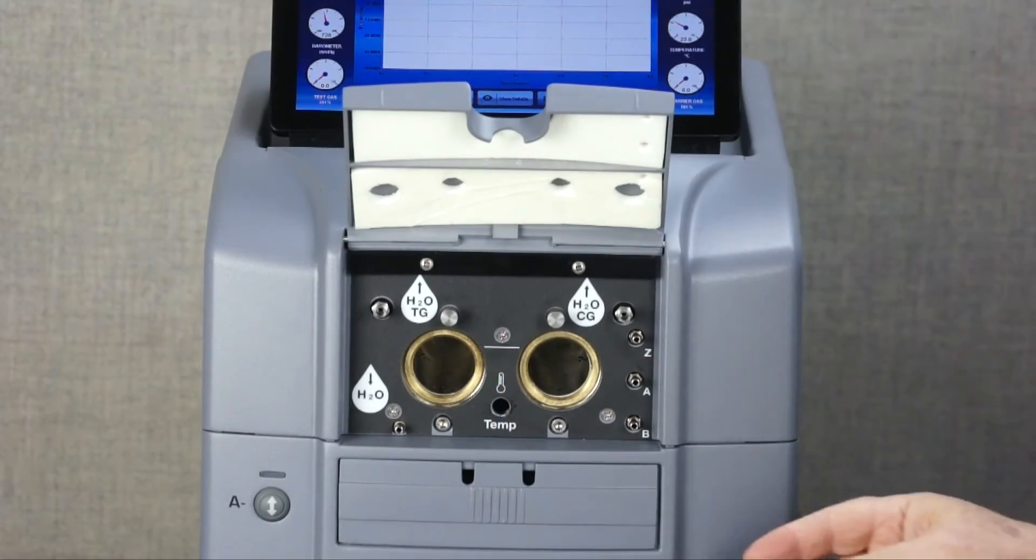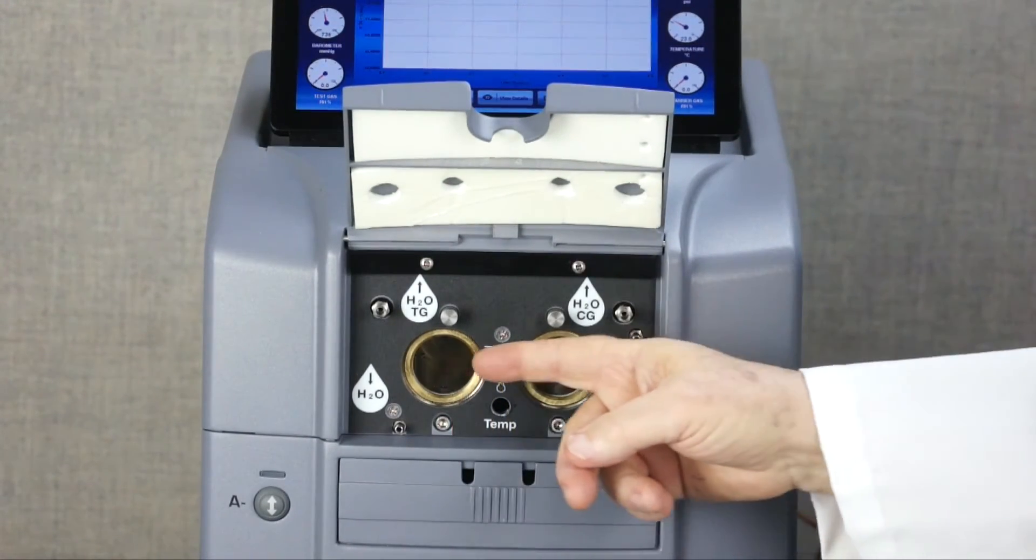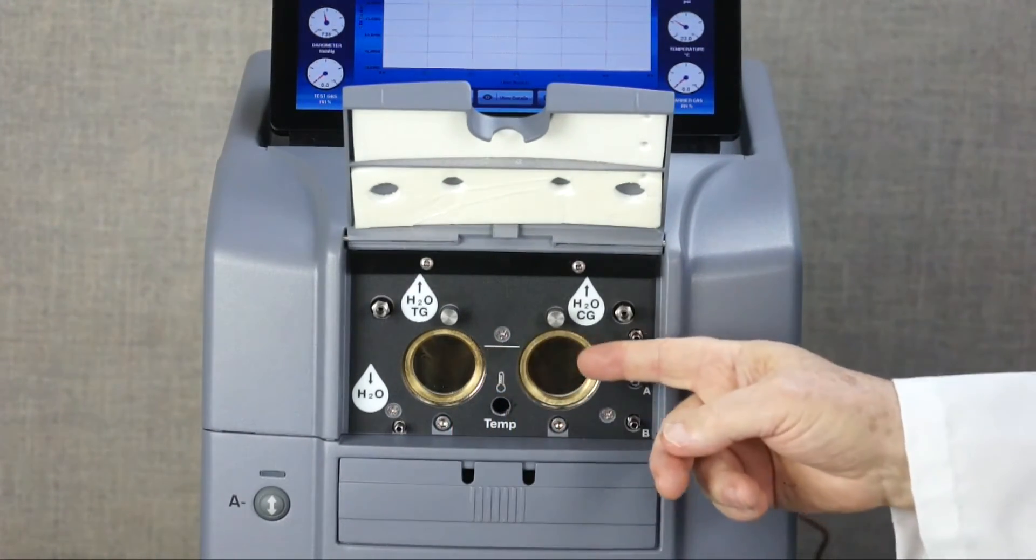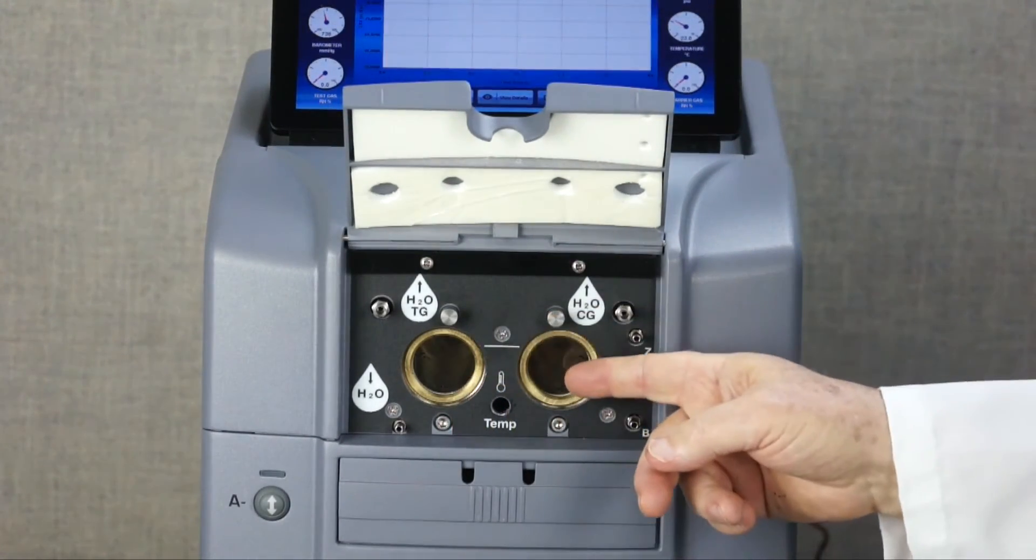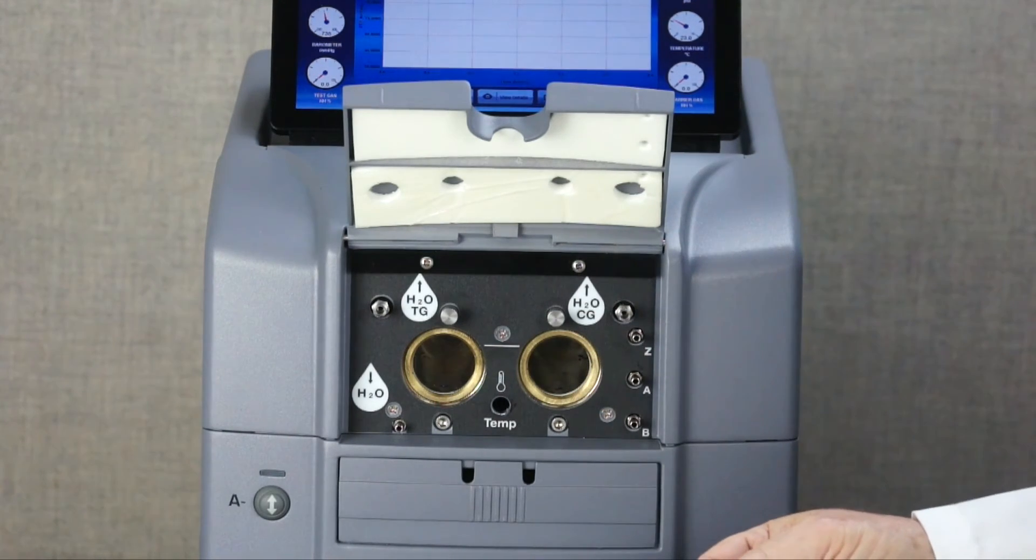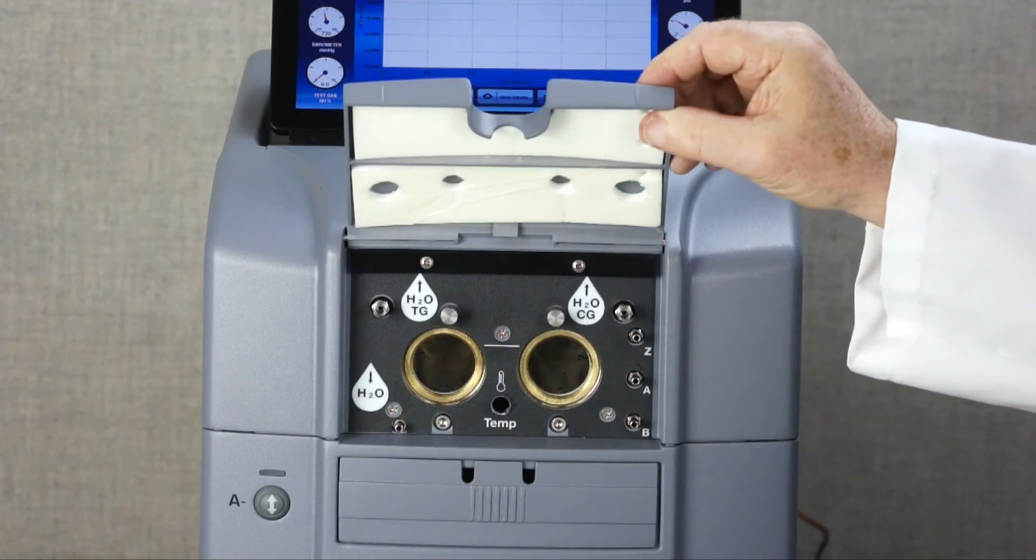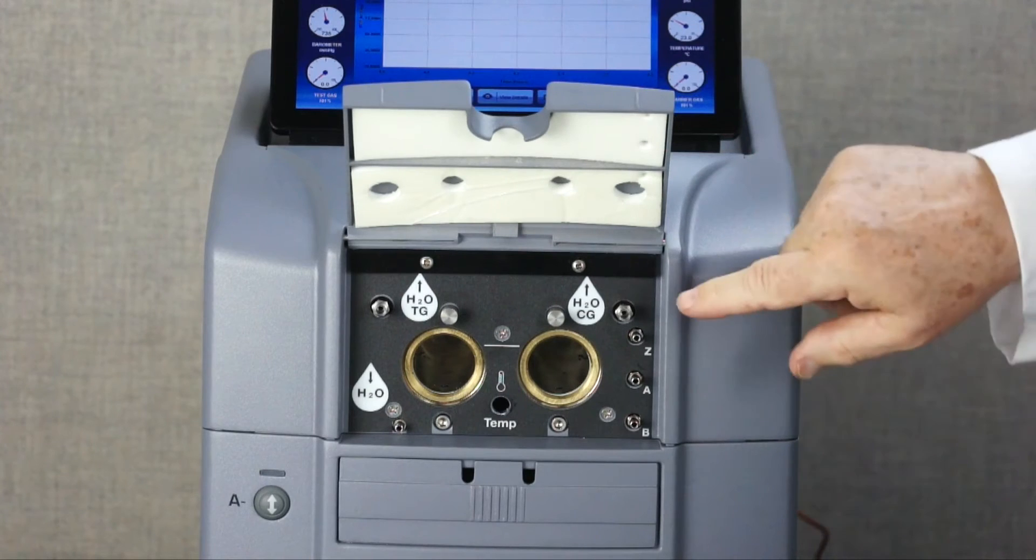We have added almost four times the amount of water that can be carried in the reservoir. Adding water is simple. Just lift the cover and inject water through this LuerLock fitting.